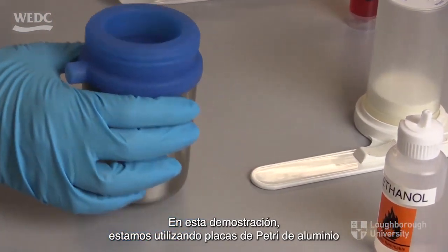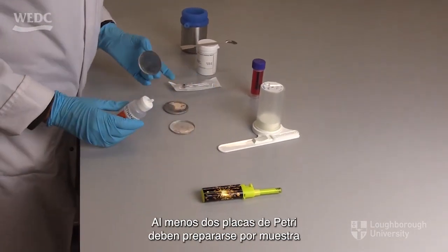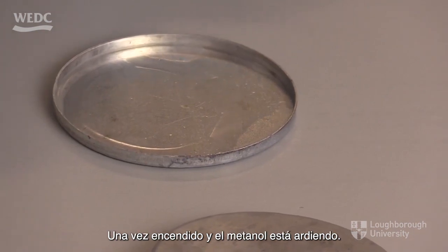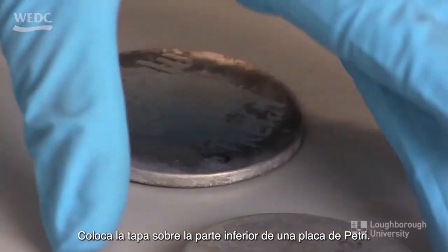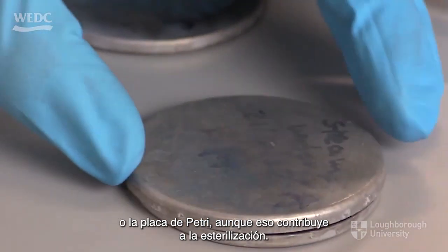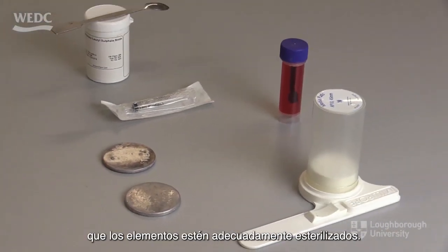In this demonstration, we are using aluminium petri dishes, which can be sterilized in the same way. At least 2 petri dishes should be prepared per sample so that you can cross-check the results. Once ignited and the methanol is burning well, place the lid over the bottom of a petri dish. Note that it is not the heat that sterilizes the filter unit or the petri dish, although that does contribute to sterilization. It is the production of the formaldehyde gas that ensures the items are adequately sterilized.